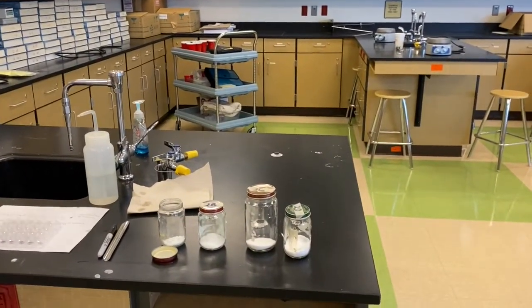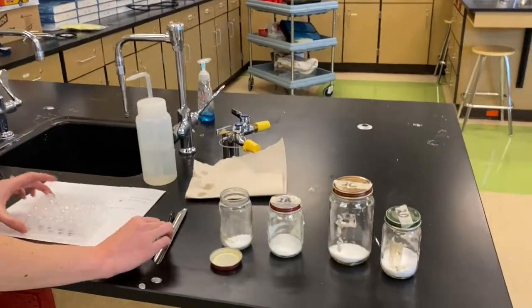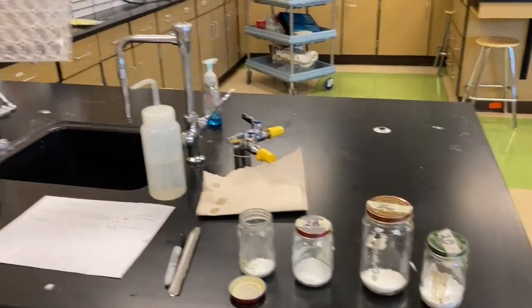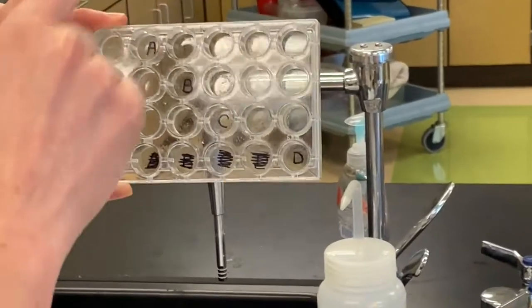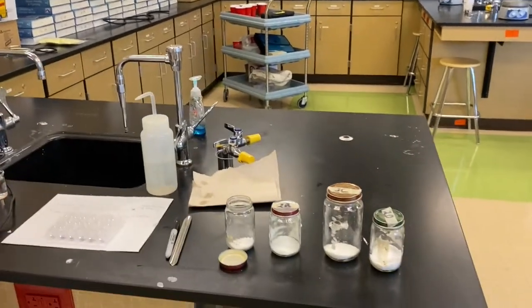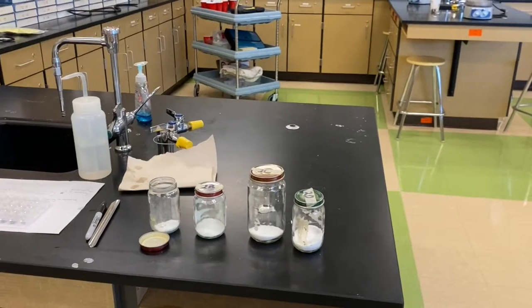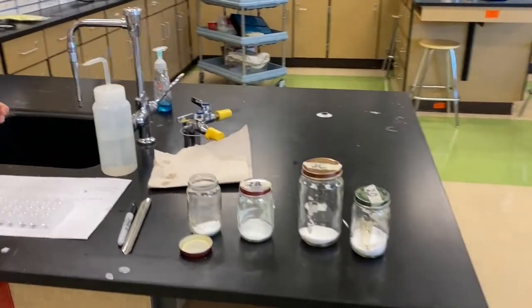All right, let's go and do it then. So following your lab instructions, once you have labeled your 4 different wells, I spread mine out just because you'll see it's a little bit difficult to get the probe to different wells if they're all super squished in together. So I spaced mine out. You're going to use a dropper. This is your plain water. I'm just going to fill that water well first.